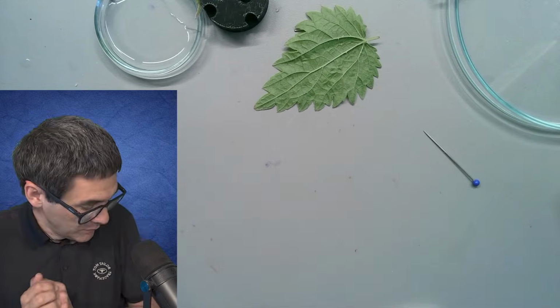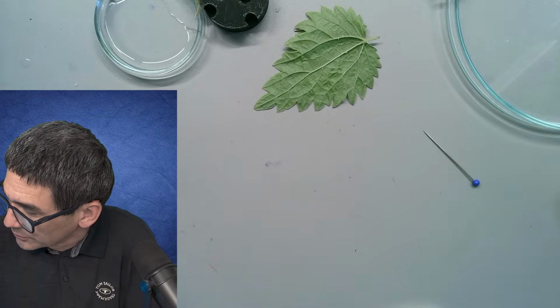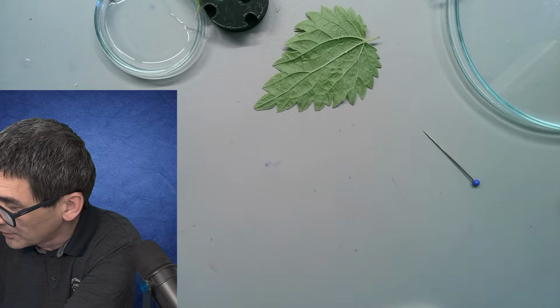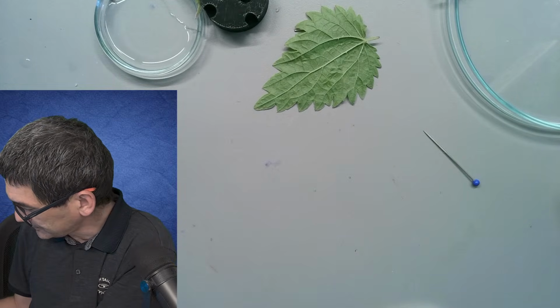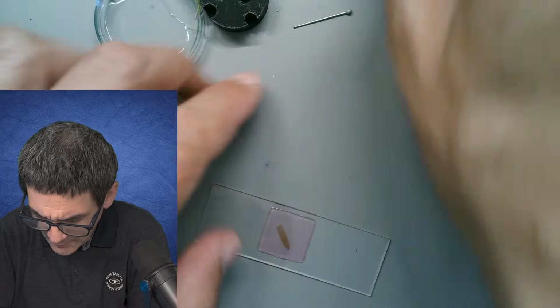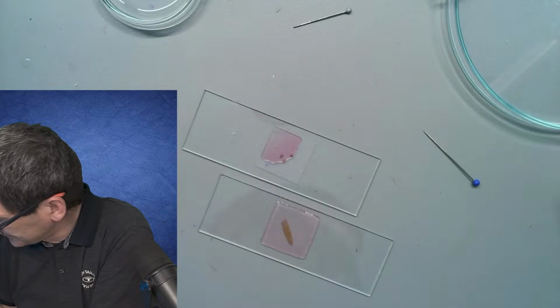So what I'm going to do now is the following. I'm going to give you a quick run through a couple of other slides, the ones that we made before, at least some of them. Some of them are about 2 weeks old or so, and I've made them just to show them here. I'm not going to spend a lot of time on them. It's just a very quick check.